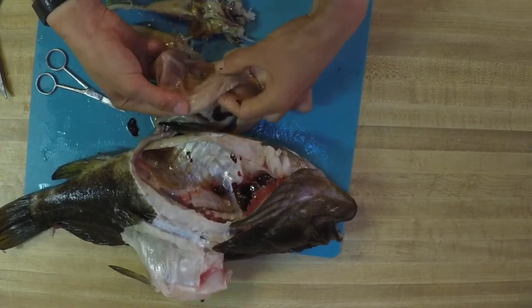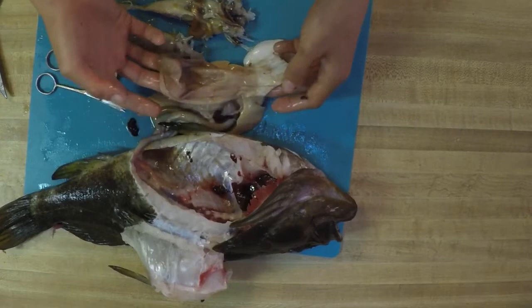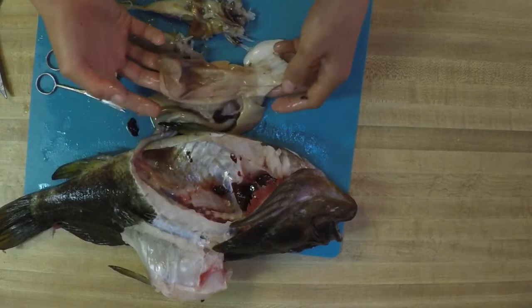While you're at it, if you want, you can take a look at the inside wall of the stomach. Generally, they have a little bit of ridges — it's not just a smooth sack. We have discovered some absolutely incredible things with this rockfish. It's truly incredible — I did not expect to see that whatsoever.